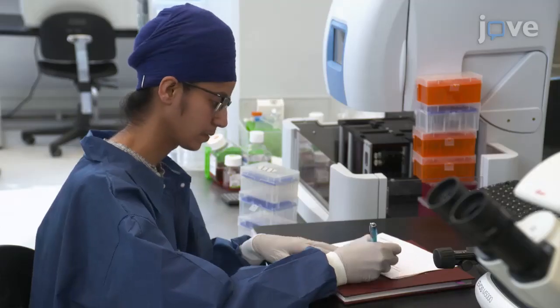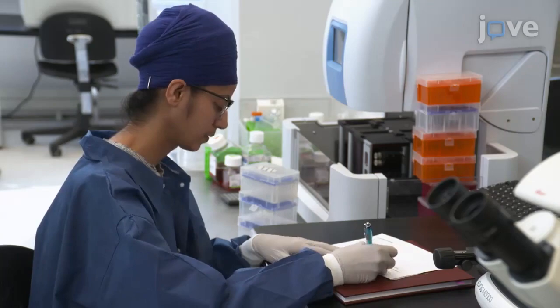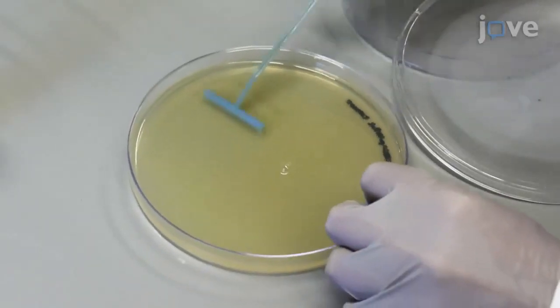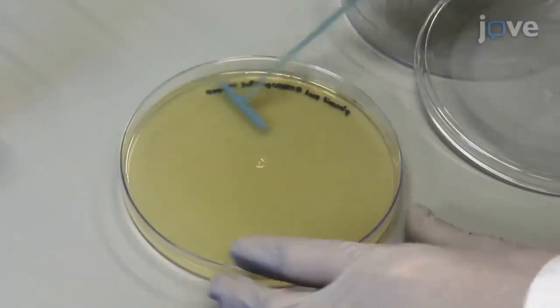Before starting a screen, ensure cell lines are carefully characterized. This includes knowing the ploidy of your cell line, doubling time, lentivirus transduction efficiencies, and sensitivities to antibiotic selection agents.